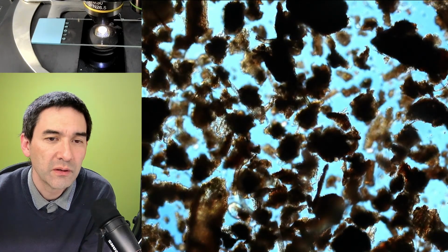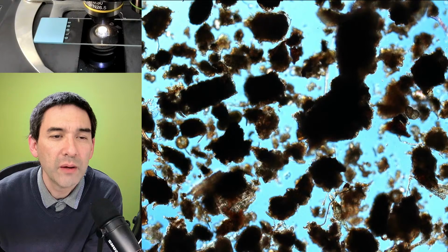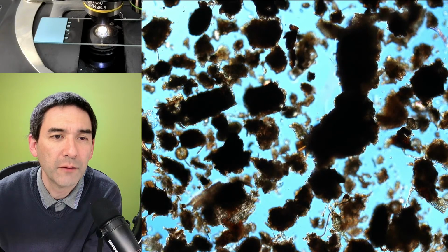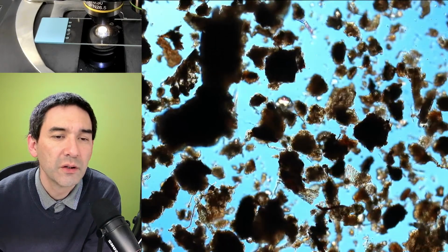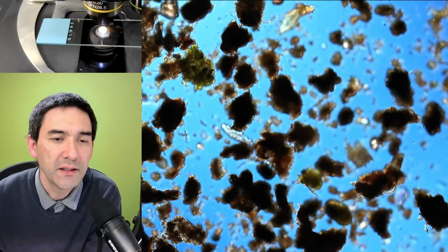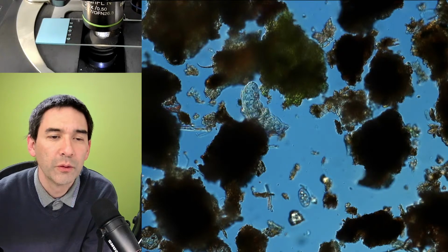So this is again, and that's one of the things: how can you actually separate the organisms from all of the other particles. That would be the next interesting thing to find out. As you see, there's lots of movement going on here. Yeah, I've also found a couple of mites in my other sample. Okay, here let's go 20 times, and here is another water bear. Okay, moving along.